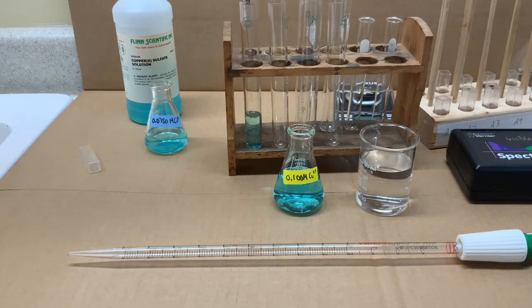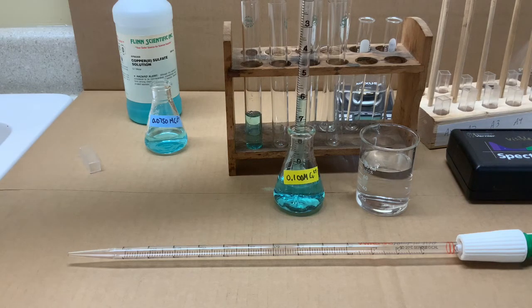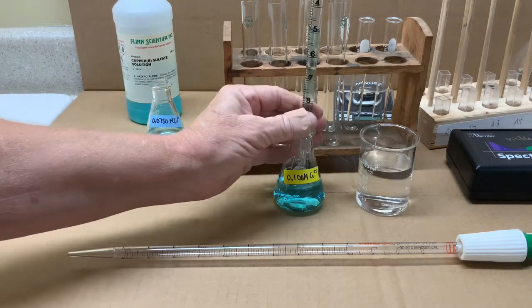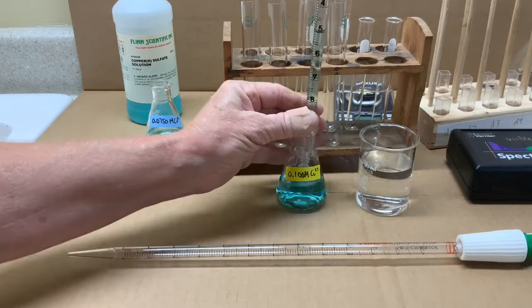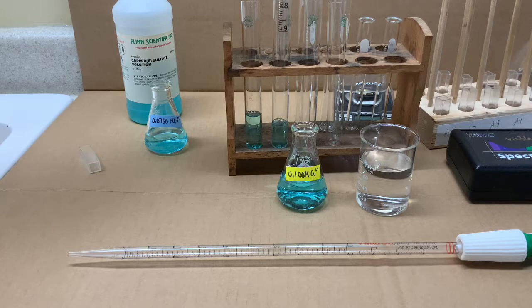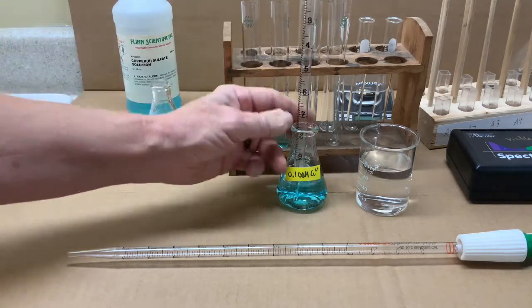That will then be repeated for solution 3, which will be 5 milliliters of stock solution poured into the test tube, and repeated again.